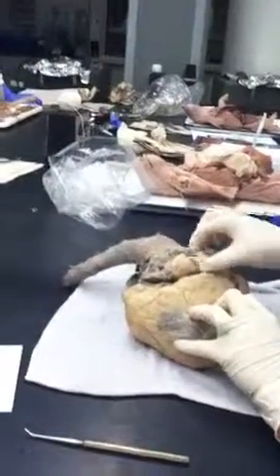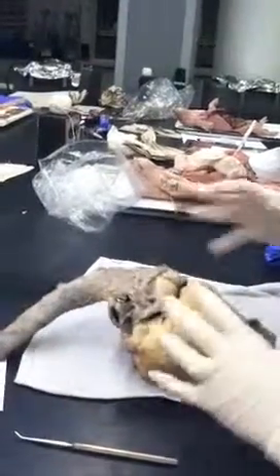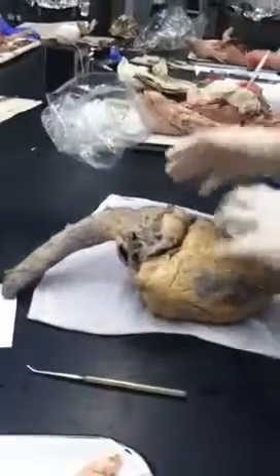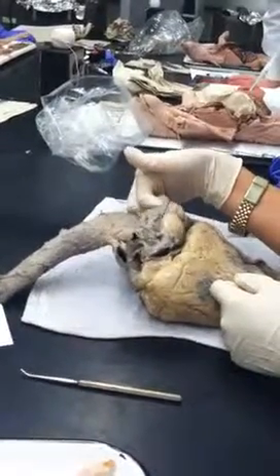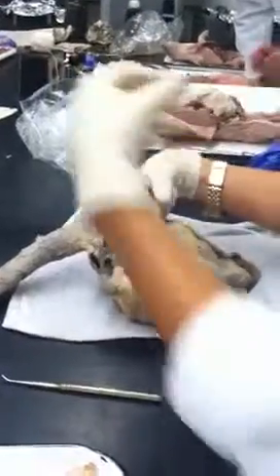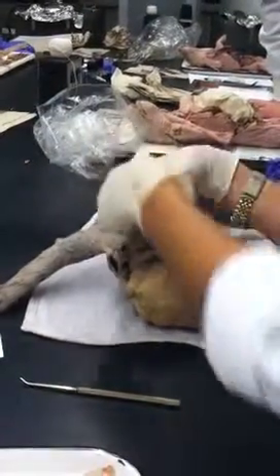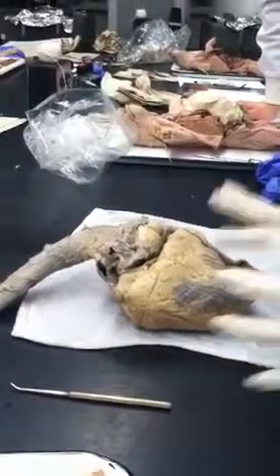Back here, we have the entrance from the cranial vena cava. Okay, so the heart is facing as if the animal is on its stomach, right? Head's over here, tail's down here, because this is the back. So the cranial vena cava is draining blood from the head and the upper body, right? So upper circulatory system. Imagine all of the stuff up here, those veins are draining and they're going right in here.